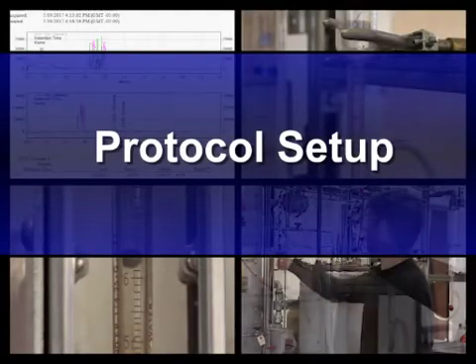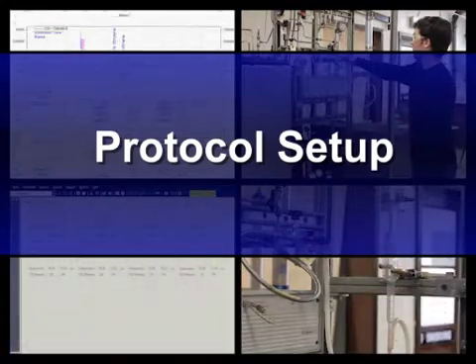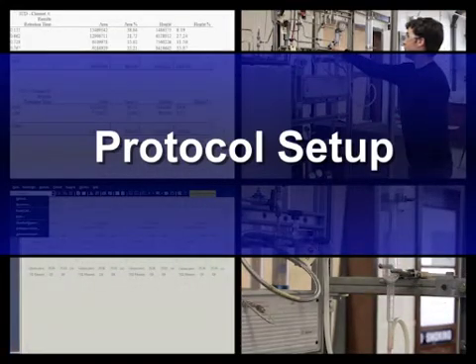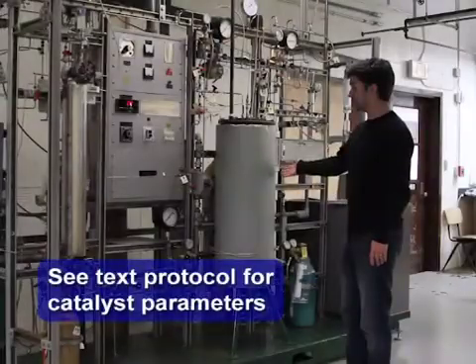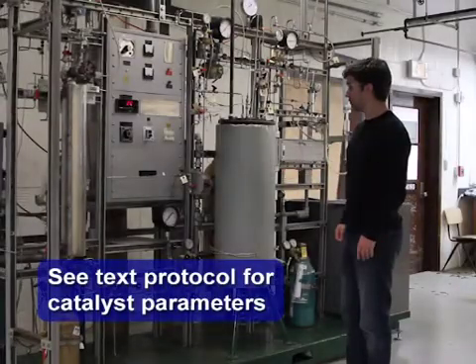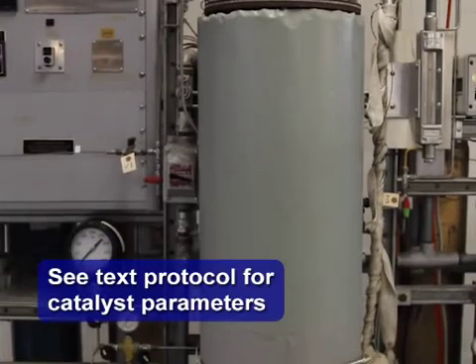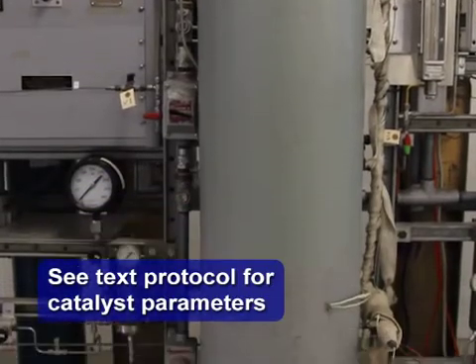In this demonstration, ethylene is hydrogenated in a catalytic reactor to form ethane. The reactor is packed with a nickel catalyst on a silica support, as well as an inert silicon carbide filler to ensure mixing.